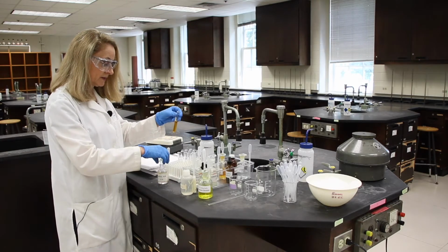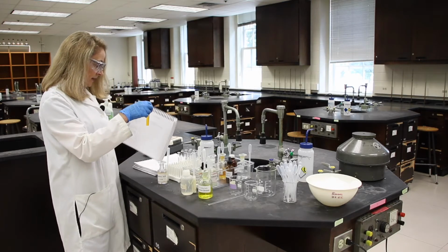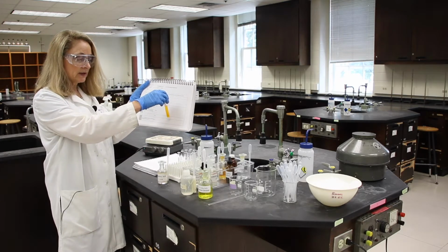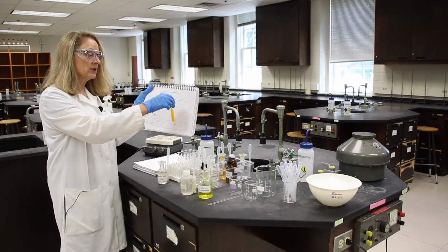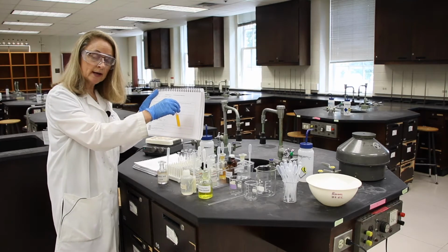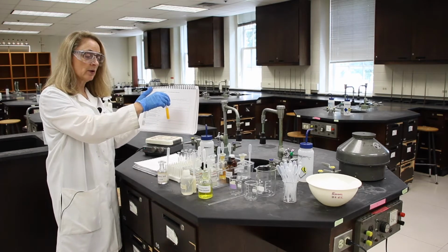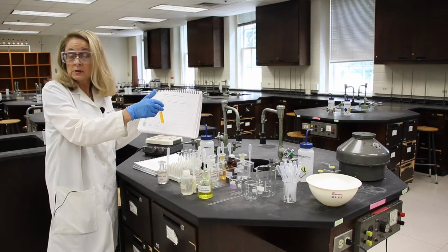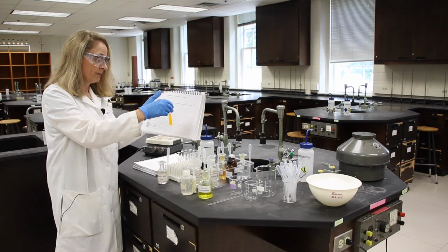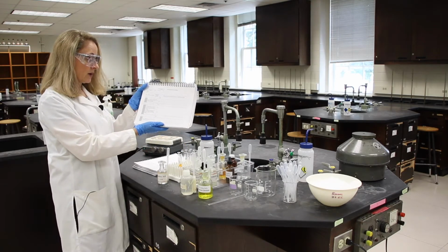And give it a mix. And we can answer the questions. The stress we added on the system was H plus from our sulfuric acid. The direction of shift is a right arrow because we have now formed more products, and we know the products are orange. And the observation is the solution turned orange. And I will let you answer the last question.